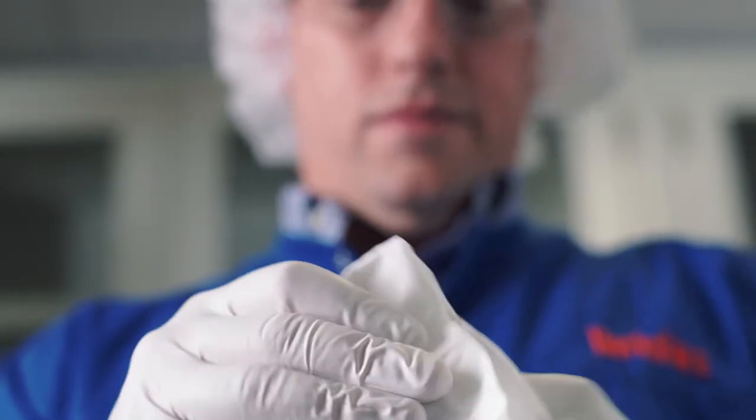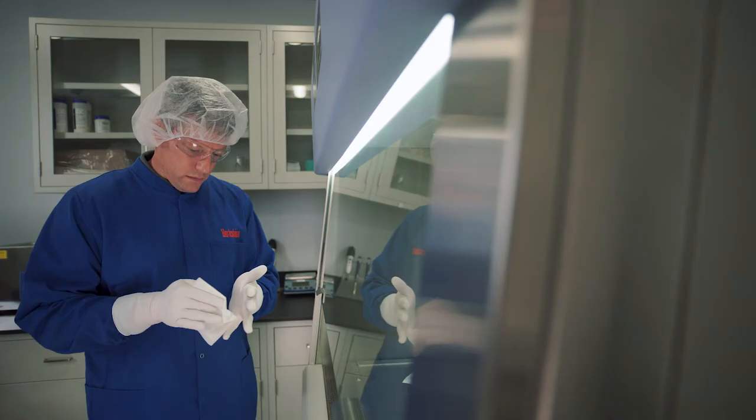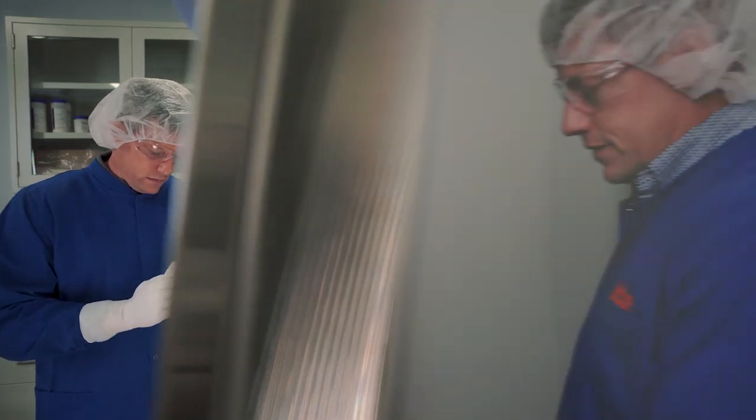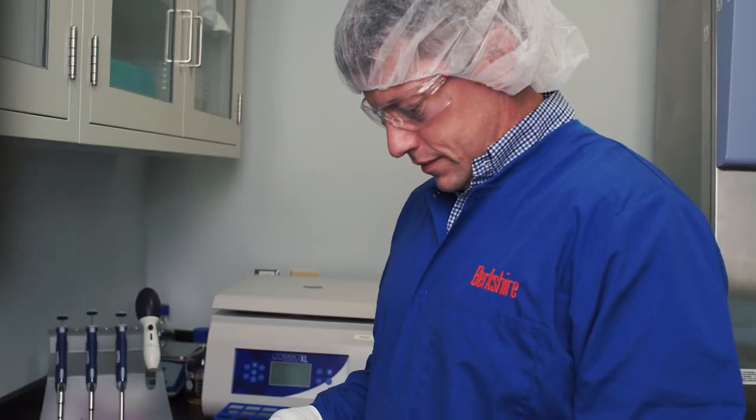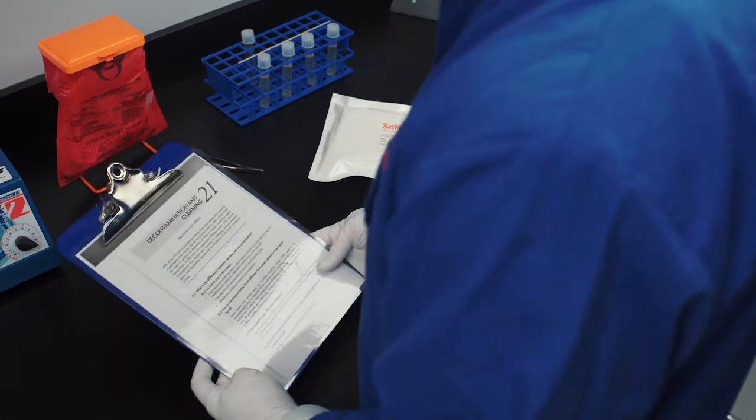Preparation for cleaning. The cleaning program should be carried out by the operators of the biological safety cabinet or suitably trained personnel according to a validated standard operating procedure.